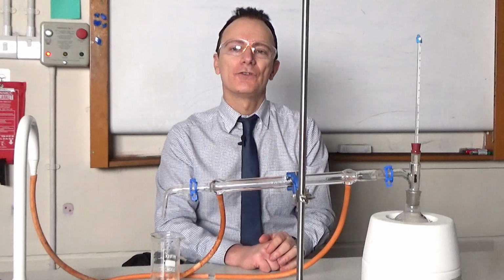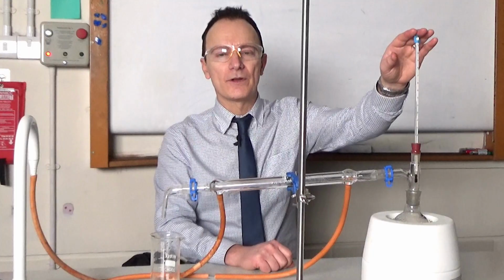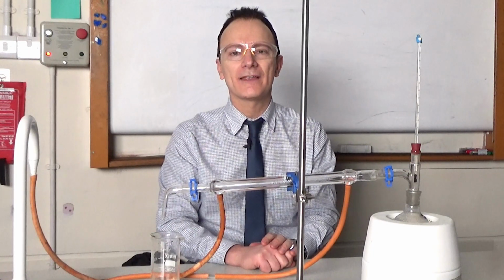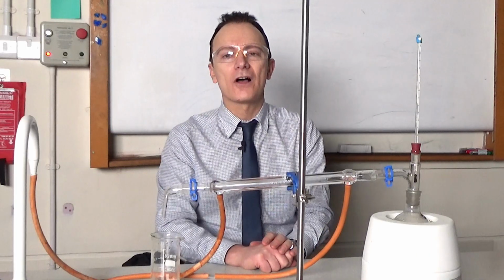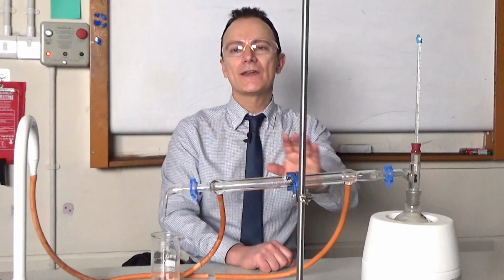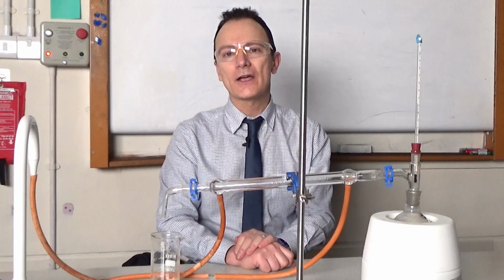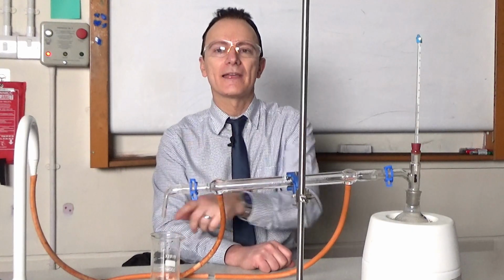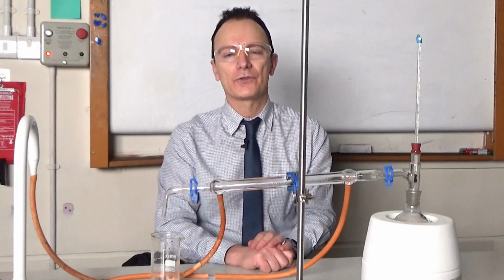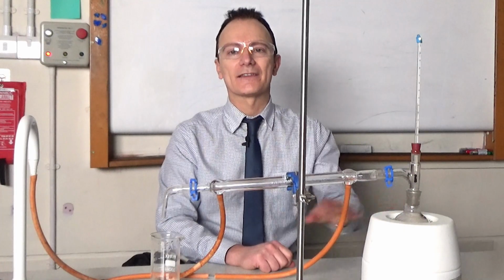So to recap, during simple distillation, the solvent evaporates when it reaches its boiling point. So the thermometer in this case would show 100 degrees as the solvent is water, and that's got a boiling point of 100. So the solvent evaporates, those vapours hit the cold condenser and condense into a liquid, and that liquid, called the distillate, is being collected over here. So we're getting water back from our solution of copper sulfate. The solid copper sulfate remains behind in the flask.